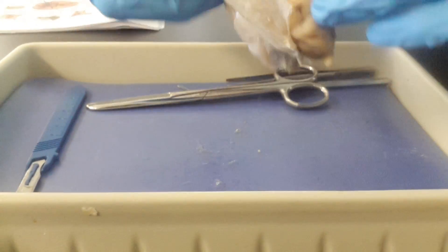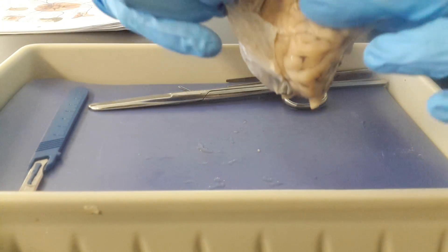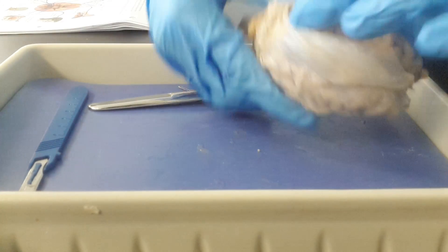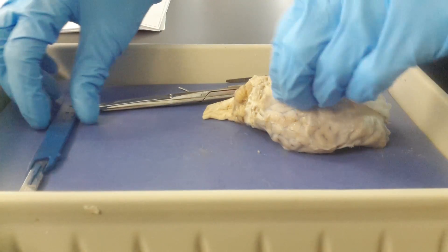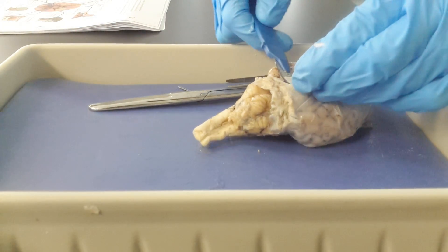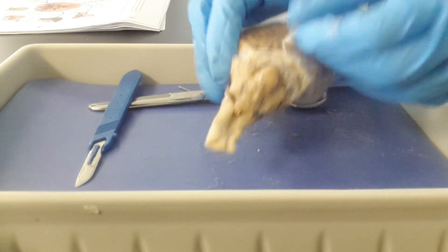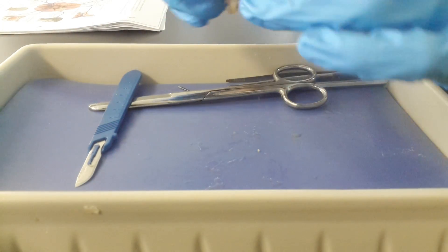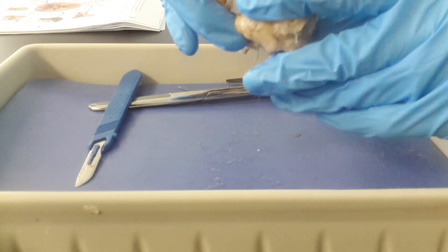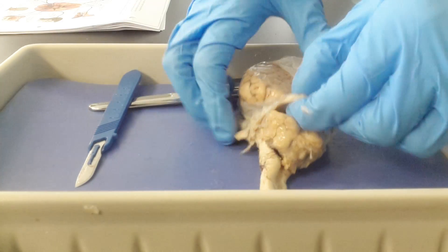As I pull this off, you can see how it creases down into that longitudinal fissure. You can also see how in the back of the brain, we have another dural fold that goes down in the transverse fissure between the cerebrum and the cerebellum.